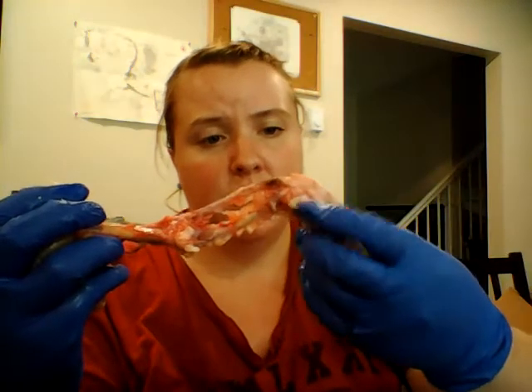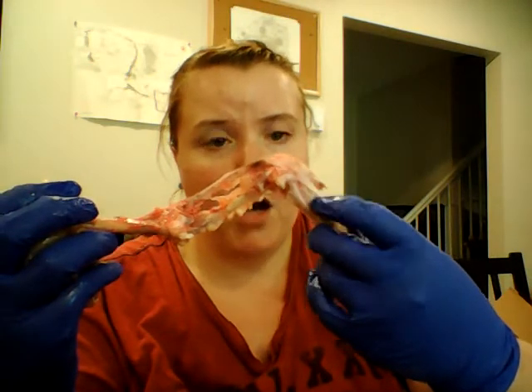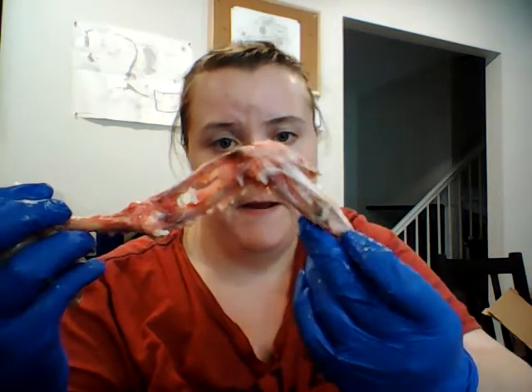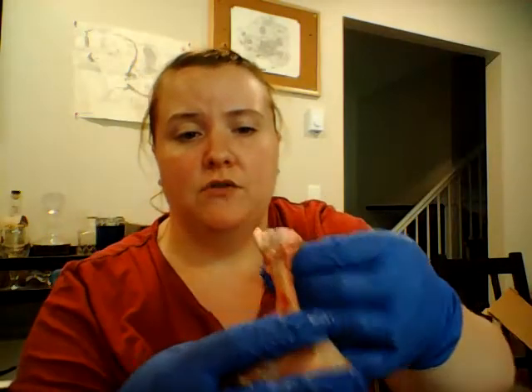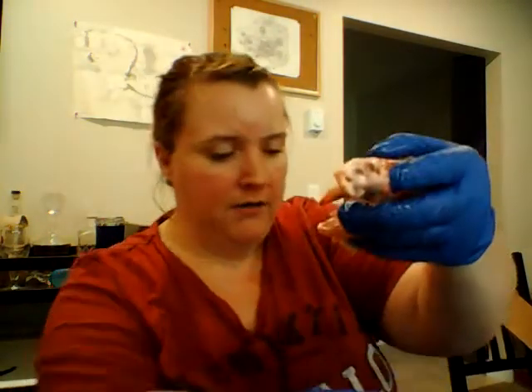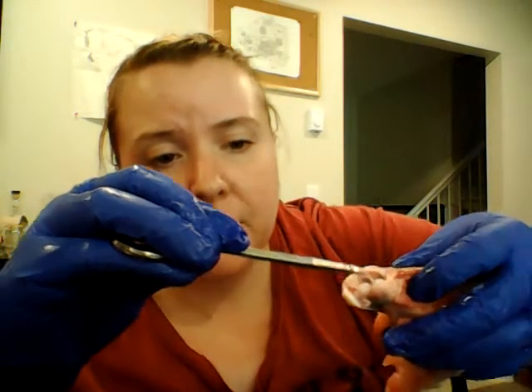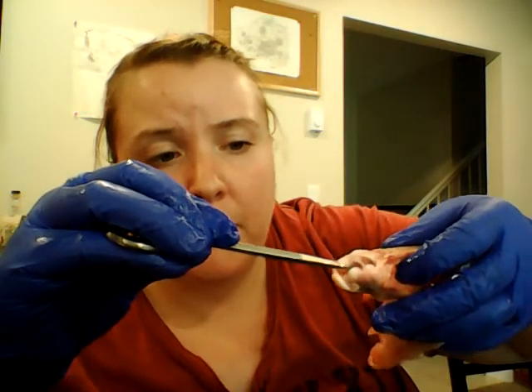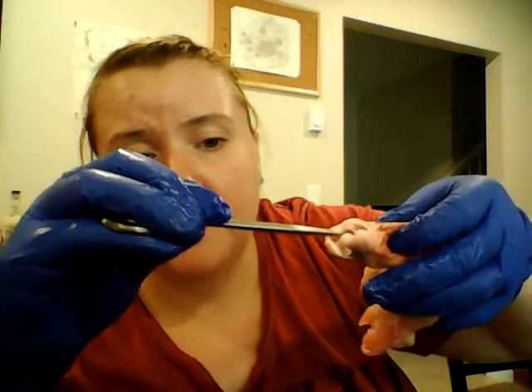Here, it was difficult to cut the skin away, but we have the metacarpals and the phalanges. So just to show you that. With the joint, I had to cut this direction here. So I'm going to show you this direction. So inside of this capsule here would be where the synovial fluid would be. That all drained out with a dissection, so you won't be able to see that.